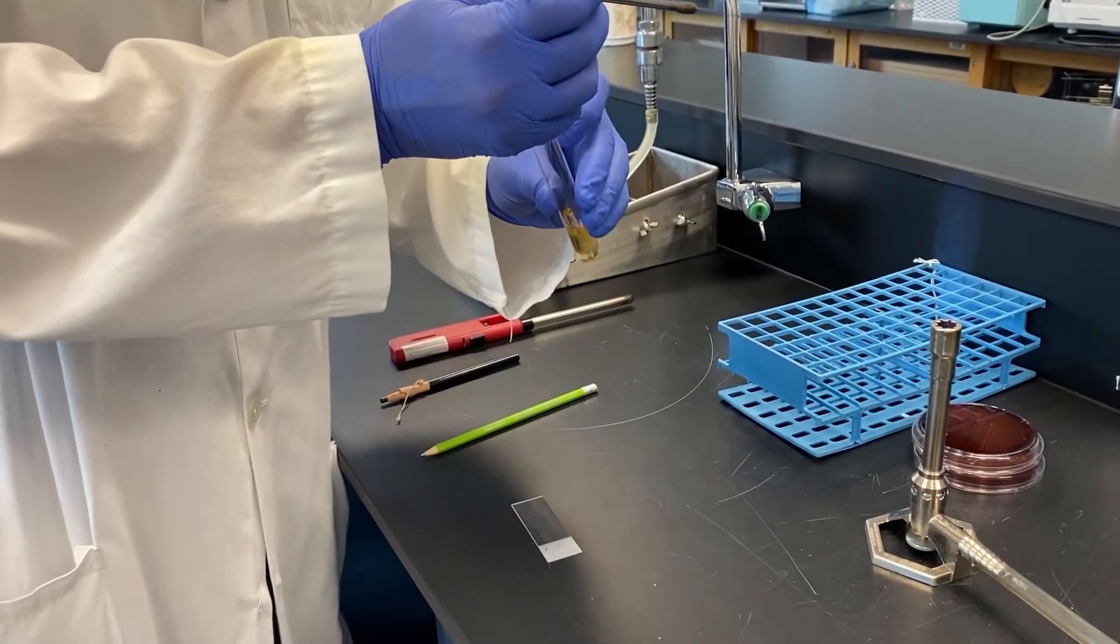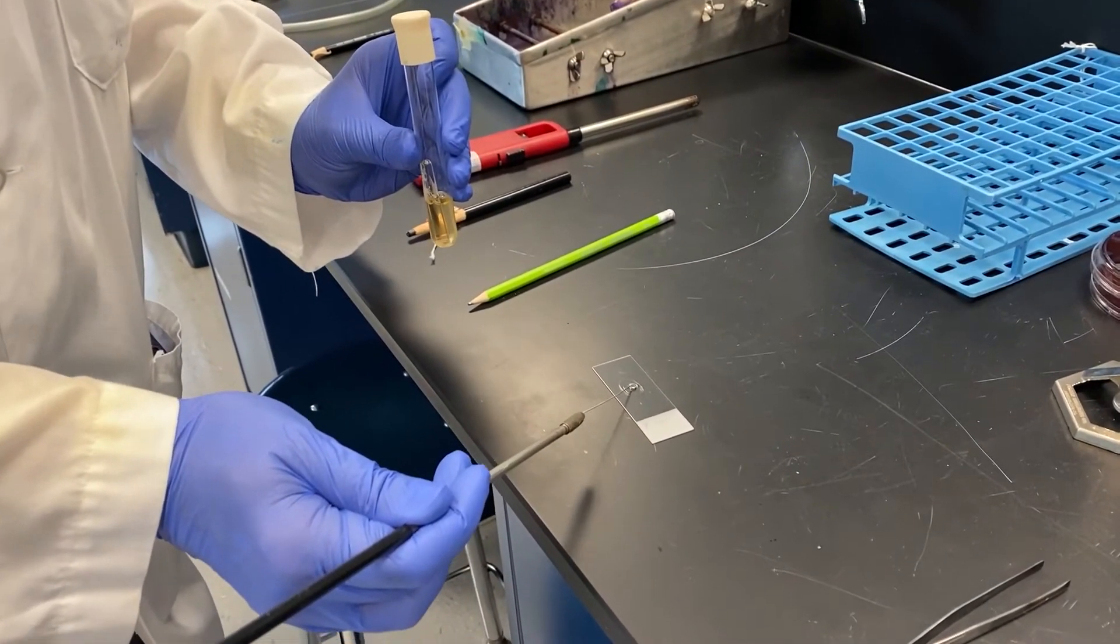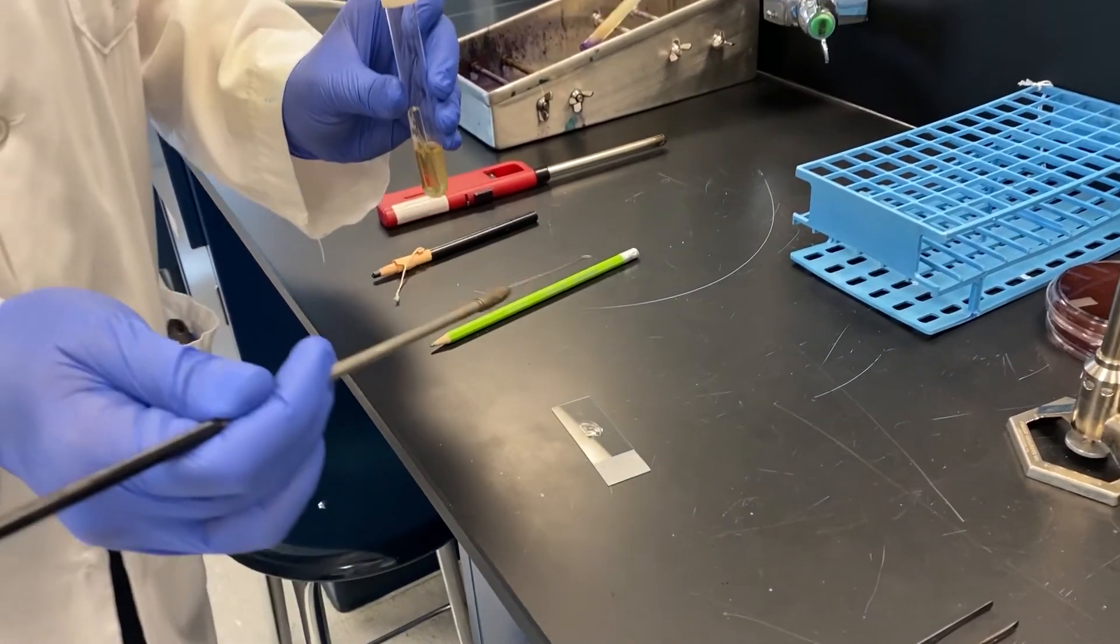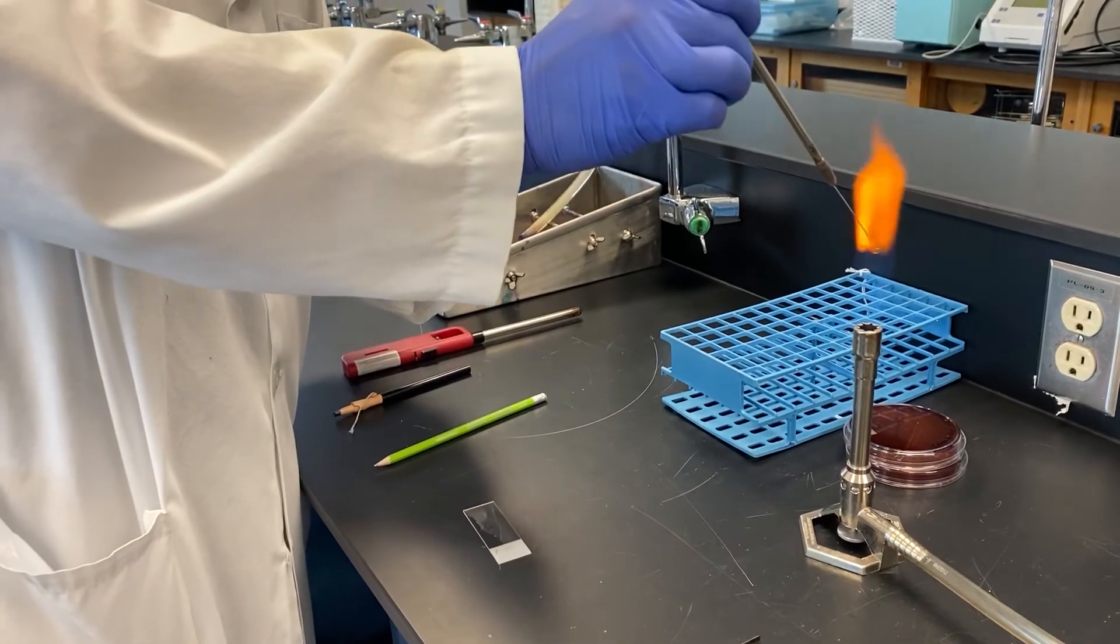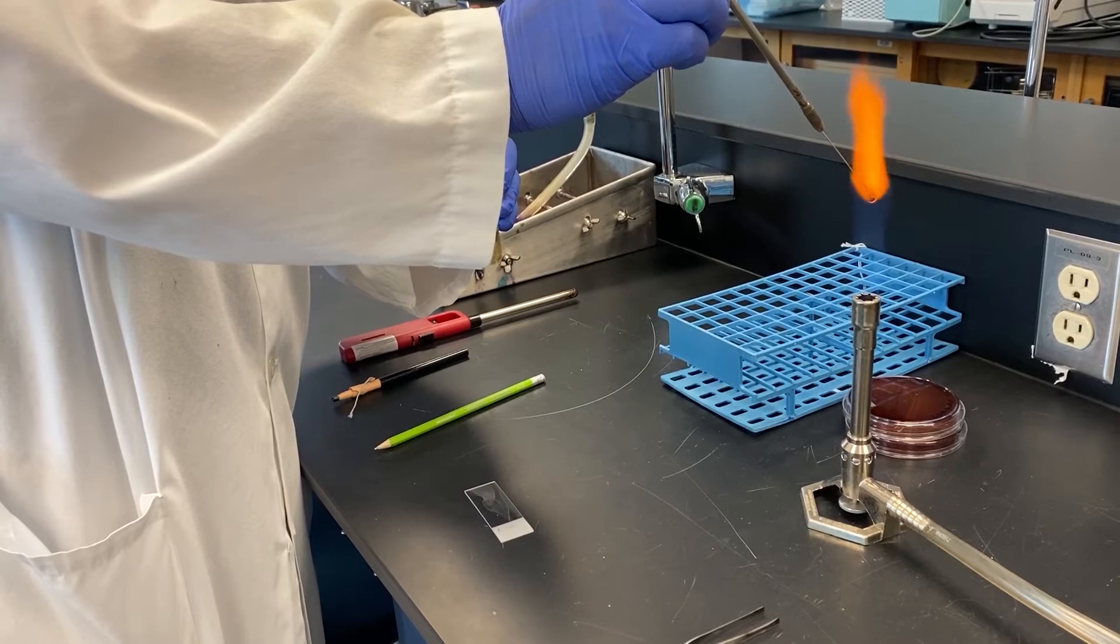Anytime you open or close a glass container with bacteria in it whether it is a test tube, flask, or bottle you always want to flame the mouth. This is common practice in microbiology. When you scoop up the bacteria from the broth culture you may hear a sizzle from the hot loop coming into contact with the broth. Don't worry that's normal.